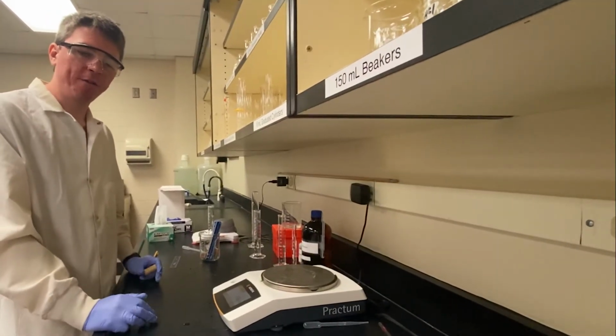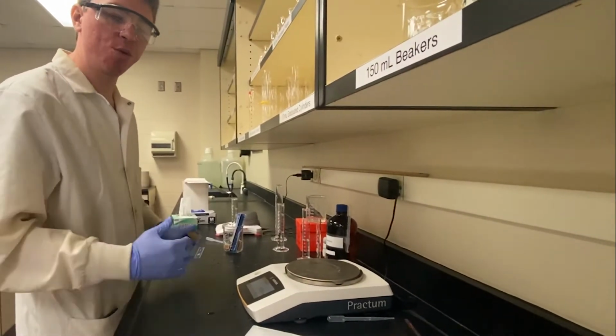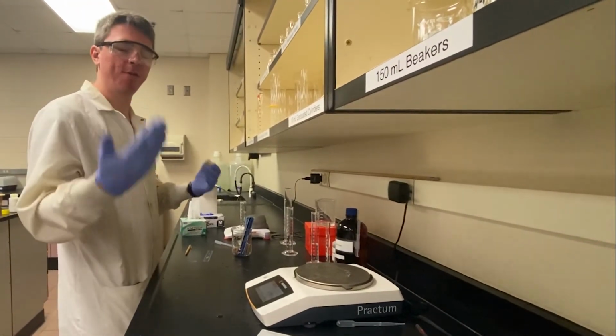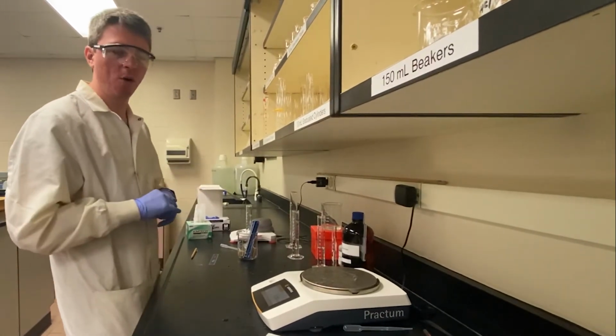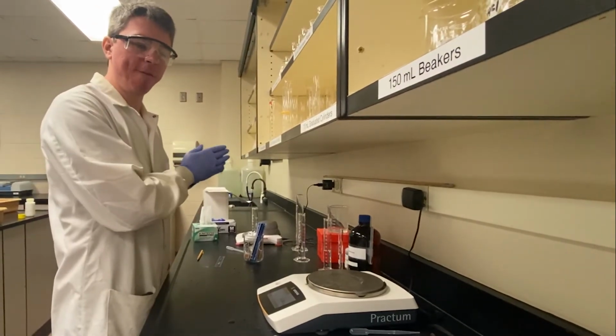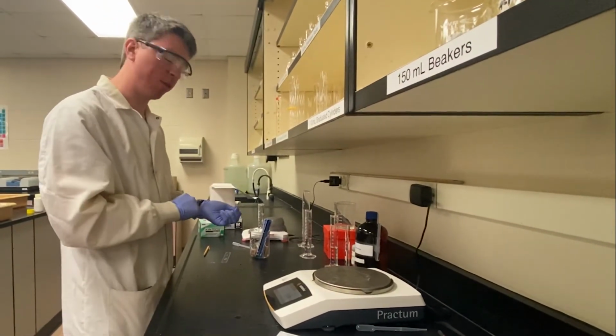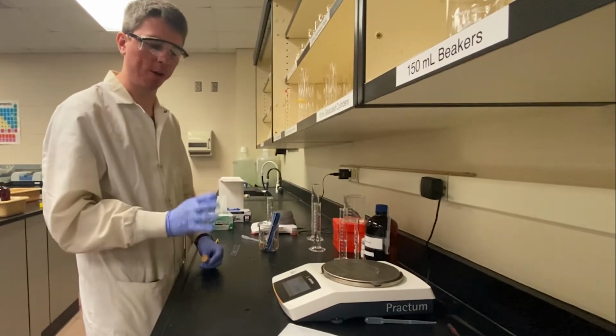So once you get all of the data for your pennies, part 3 is actually going to have you use that data, as well as if you were in face-to-face, all of the class groups data or all of the data provided to you to plot the density of pennies over decades. But the post-lab questions and slides for that will help walk you through those.